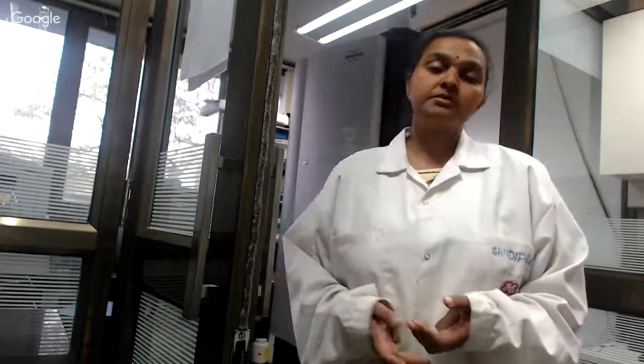Thank you, Professor Srivastava. So good evening to all the participants who are there online. Like Professor Sanjeeva just said, we'll be handling the MALDI-TOF instrument today. Details of this would be discussed. So this instrument, like he rightly mentioned, is used mostly for the analysis of proteins, polymers, nucleic acids, carbohydrates, and a lot of other samples.